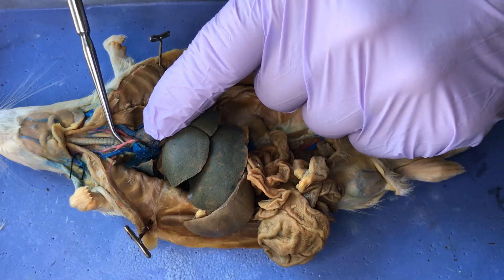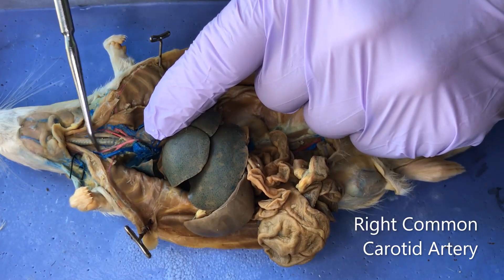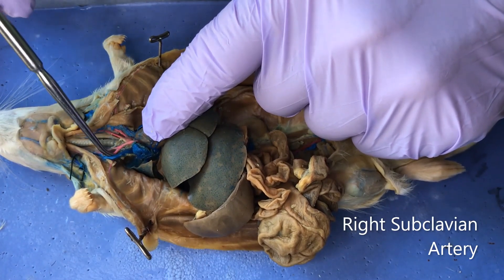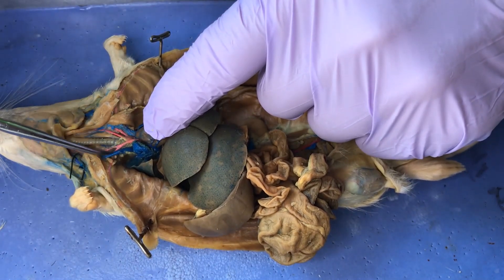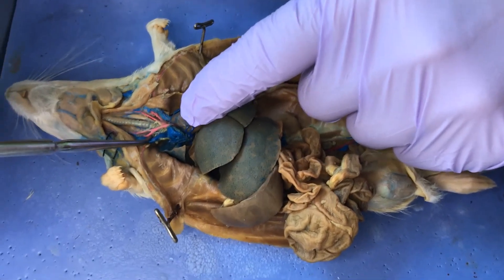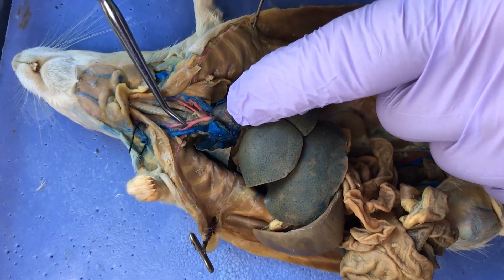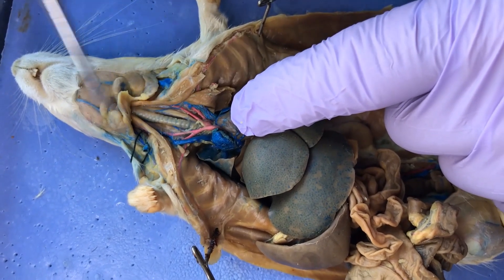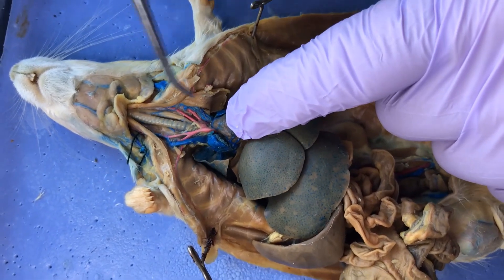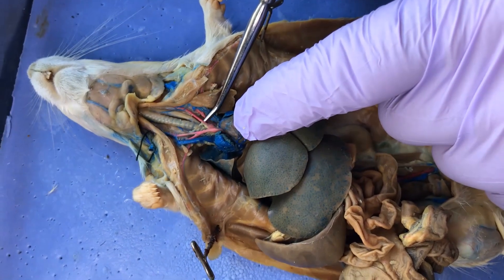The brachiocephalic trunk only goes a short distance before it splits into the right common carotid artery and the right subclavian artery. I'm going to push this vein out of the way — so the right subclavian artery is right there. Subclavian means below the clavicle, so this vessel goes off to the arm, whereas the common carotid goes up and eventually splits to supply the brain.